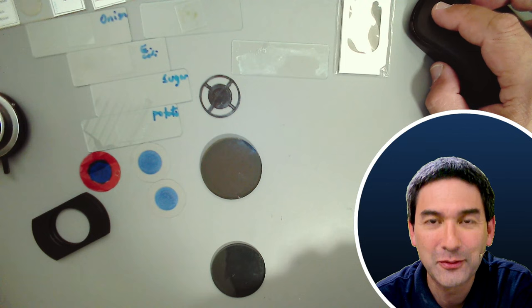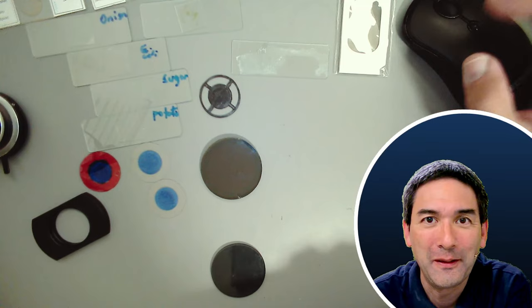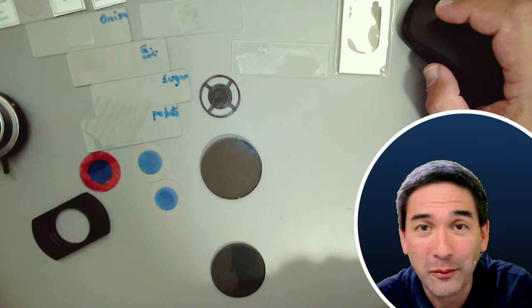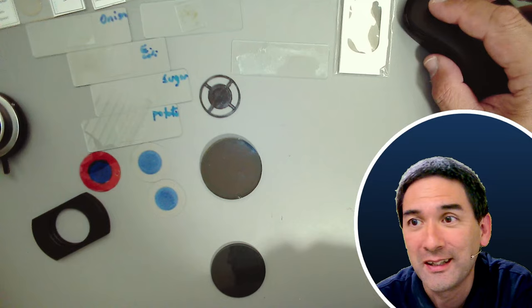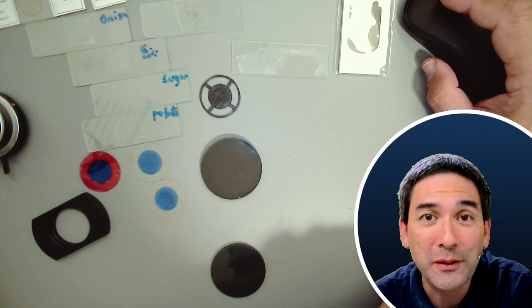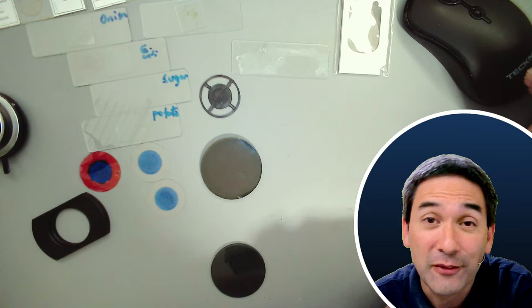Hello everyone, Microbe Hunter here, welcome to another Saturday live stream. Today, maybe a little over an hour, I want to show you different microscopy contrasting techniques - a more or less complete overview of what you can do even at home, DIY style, to make your own filters. I also want to show some other contrasting techniques like DIC and phase contrast, which unfortunately you cannot do at home.